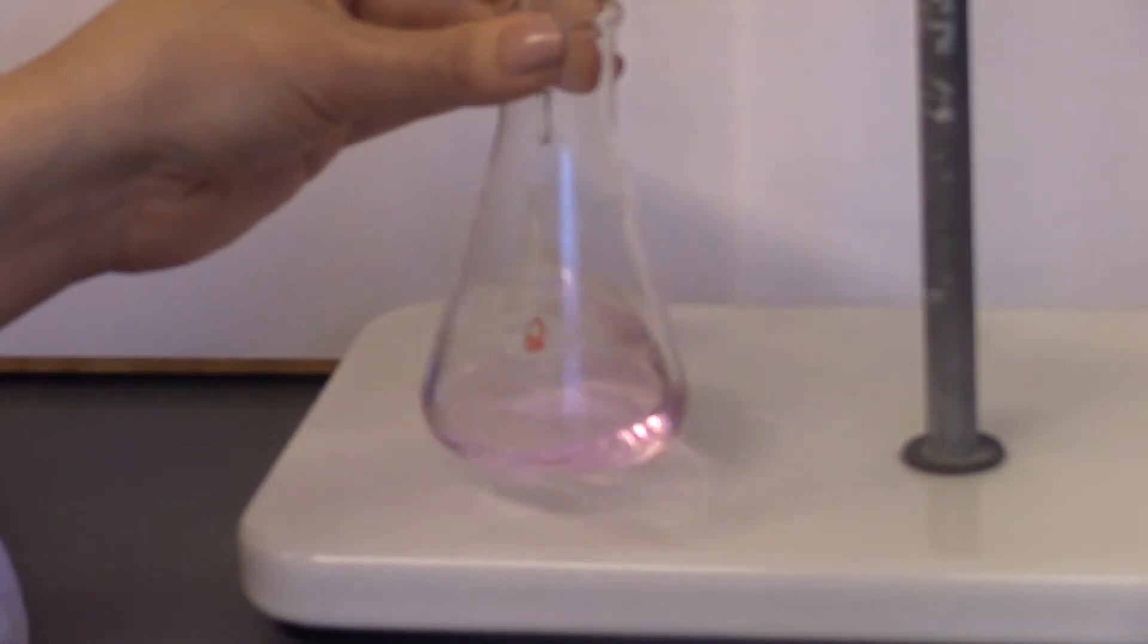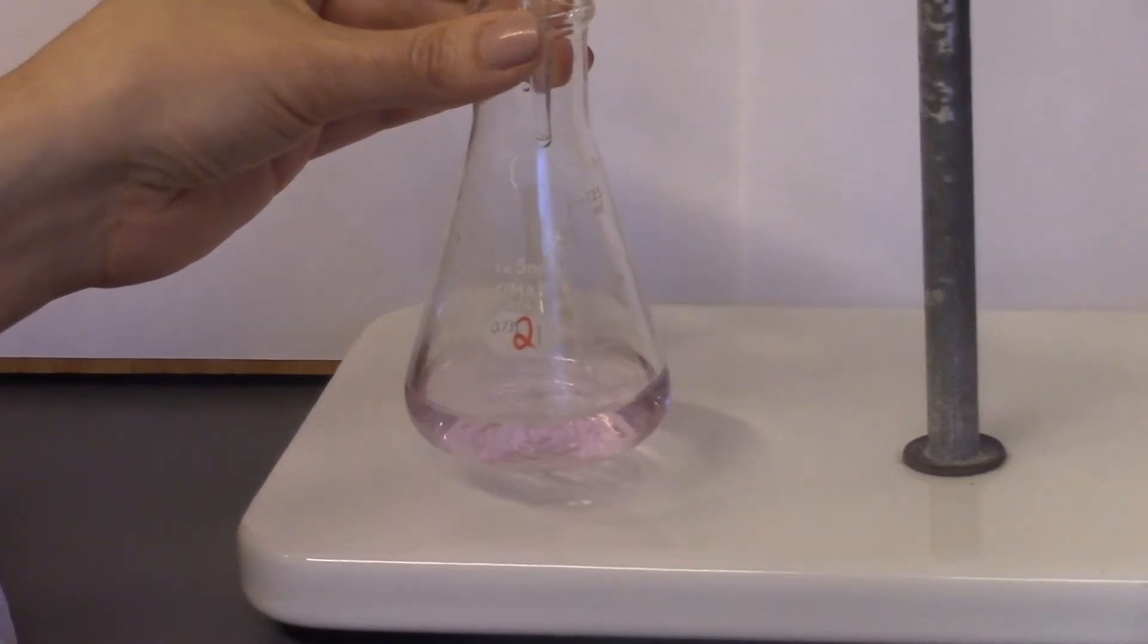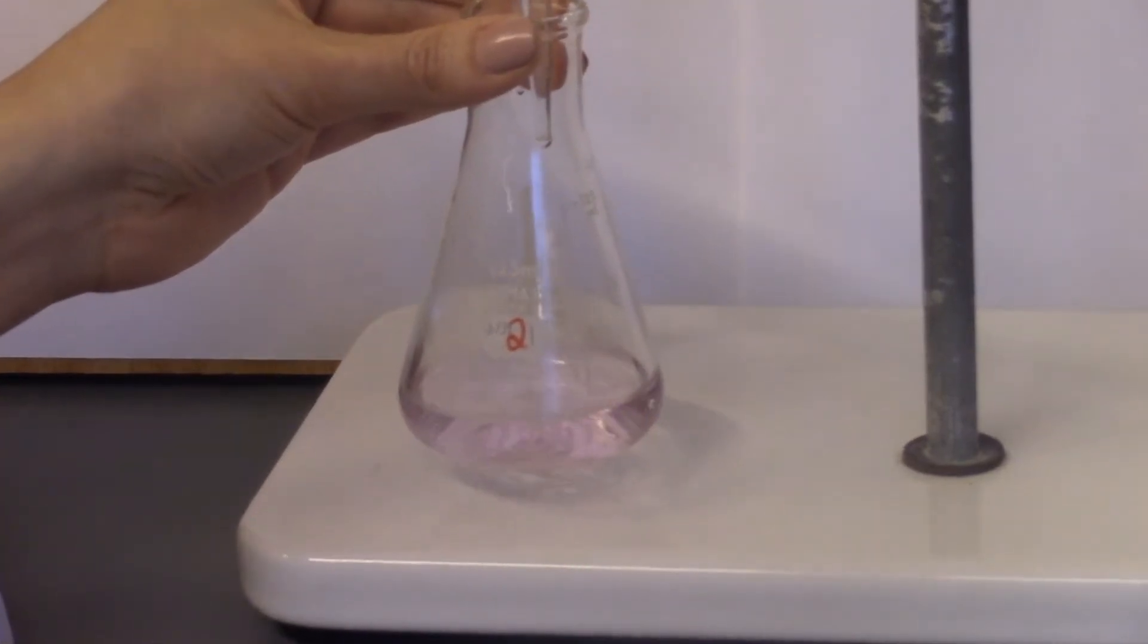As the titration proceeds, the pink color will start appearing and disappearing. Keep patience and slow down the addition as the color persists longer.